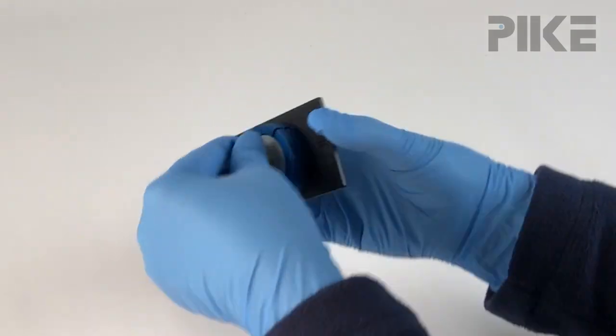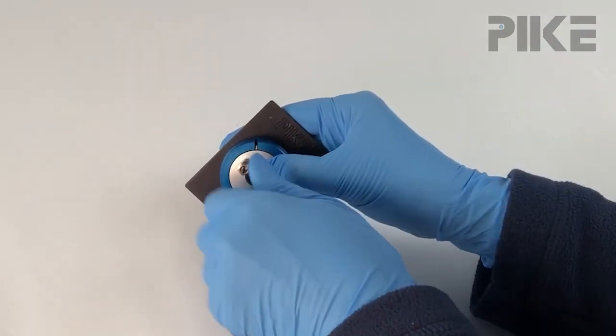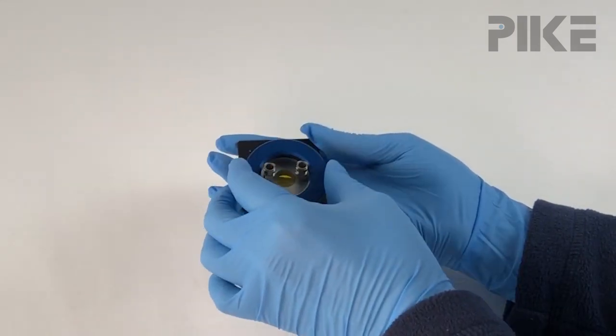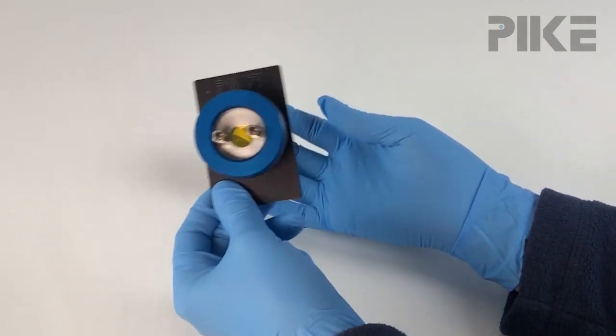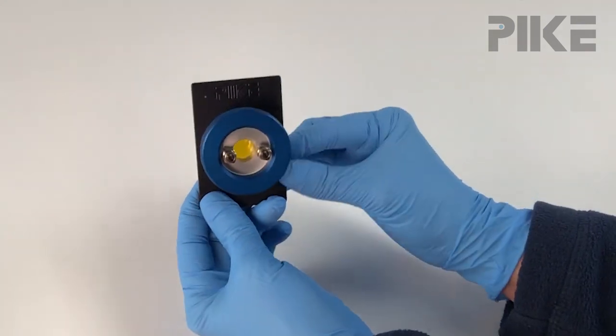And once you've assembled the cell, flip it and remove your alignment caps. Add your Teflon O-ring, that acts as a little spacer, and then add your cap on and tighten that down. And once it's tightened, give your cell a little shake to see if you can hear any of those windows rattling. And if you don't, your cell is now ready to use.